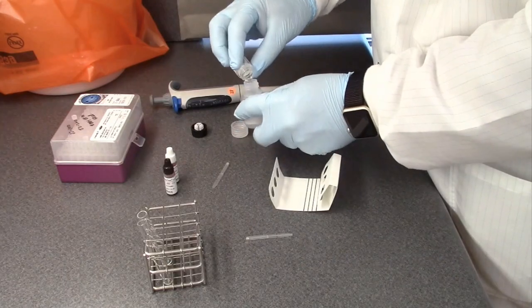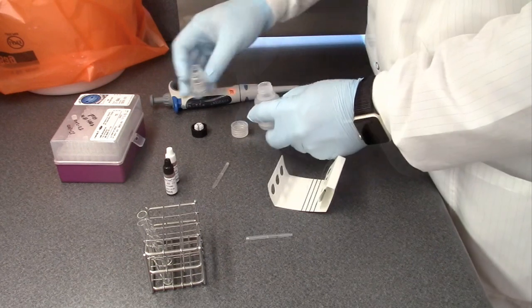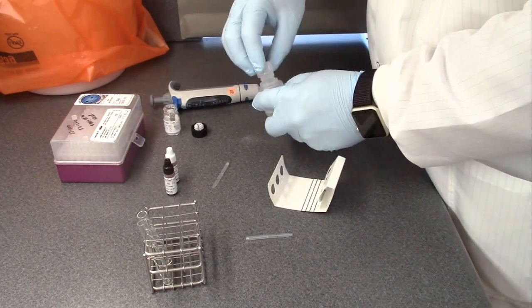Prepare the buffer solution by adding the reagent powder to the solution buffer. Swirl to mix and allow it to sit.